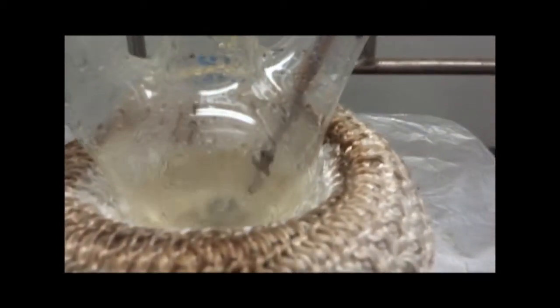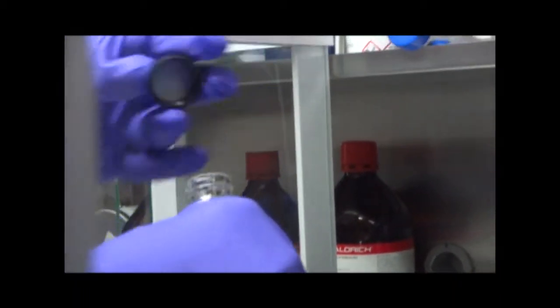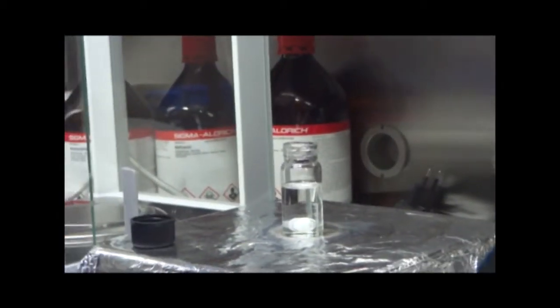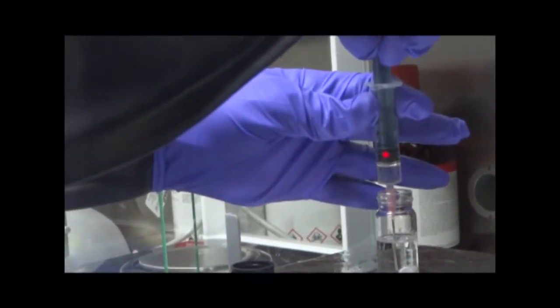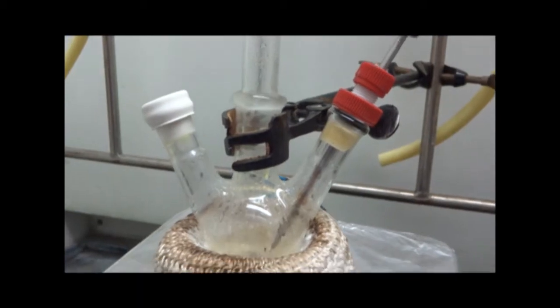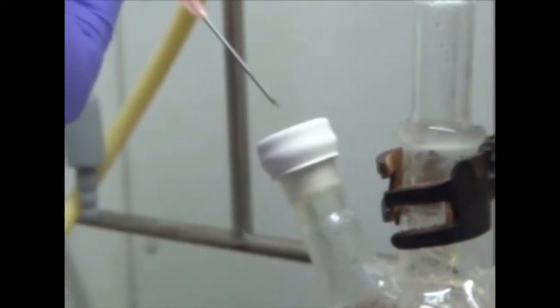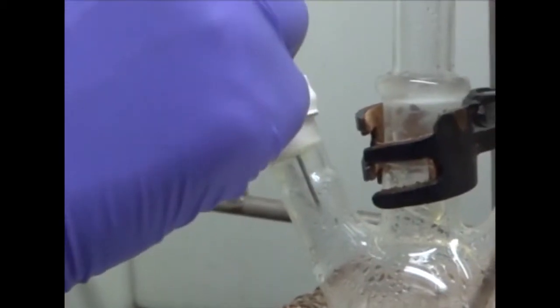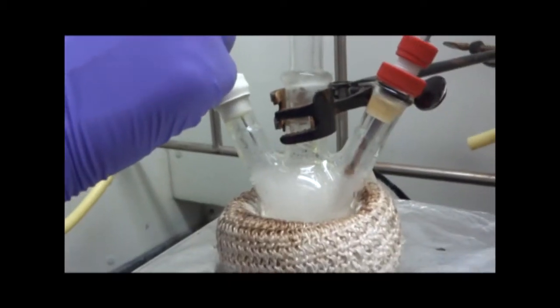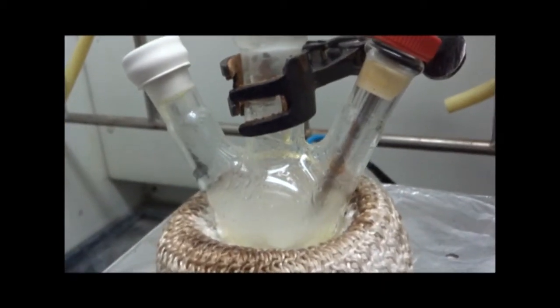The solution is clear now, so we can inject the selenium into the cadmium oleate solution. Let's take out the selenium solution. We are using thick needles to facilitate fast injection. This process gives us precise control over size. We are injecting cold selenium solution into the hot cadmium oleate.